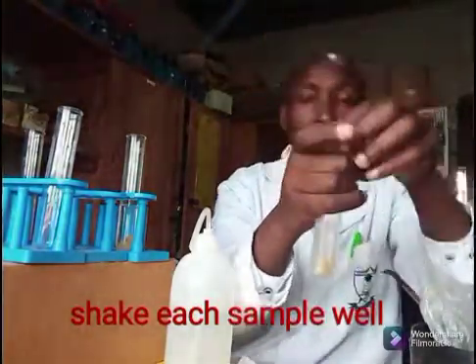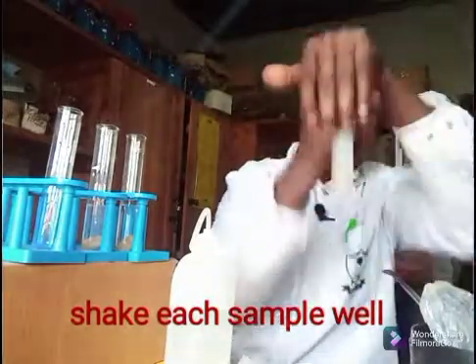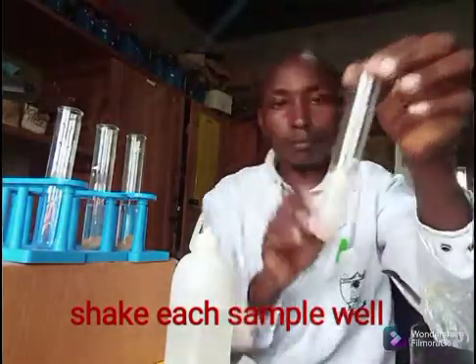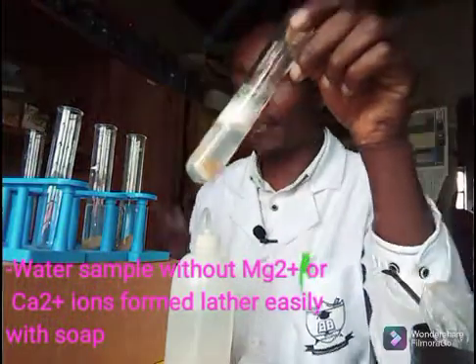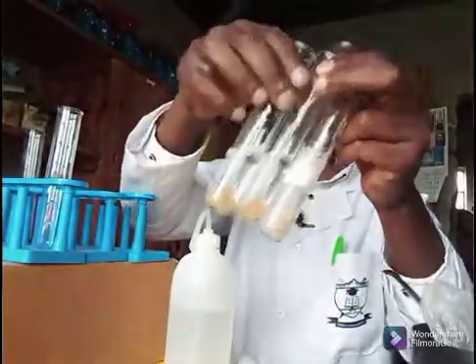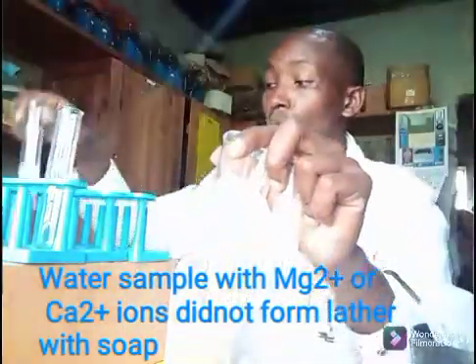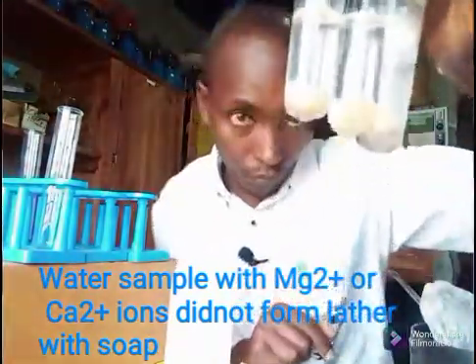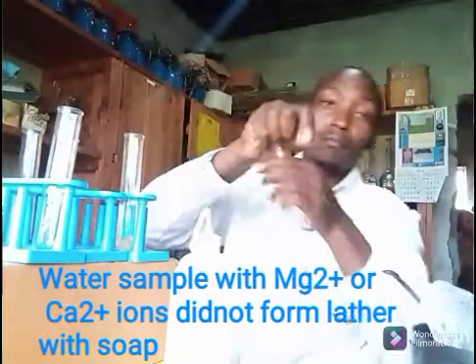The other ones I will shake and observe. Finally the last one. You can observe what is happening. This one was water without magnesium or calcium ions, this one had magnesium ions, this one had calcium ions, and the fourth one had magnesium ions. Let me shake them again once more and observe.